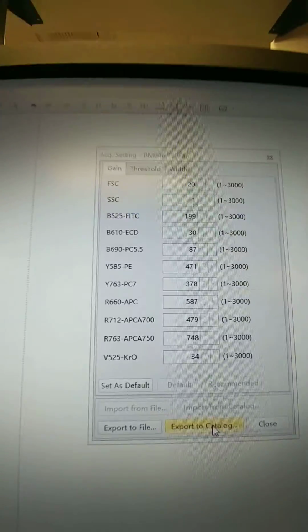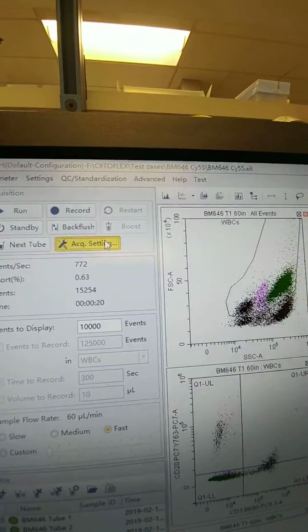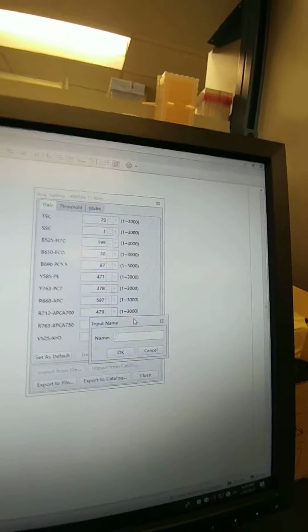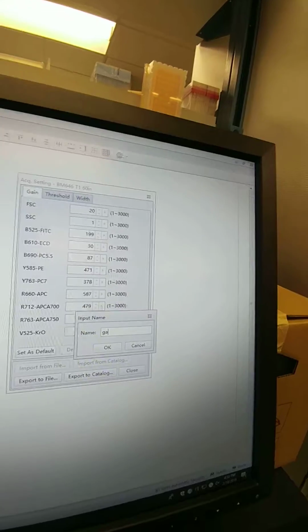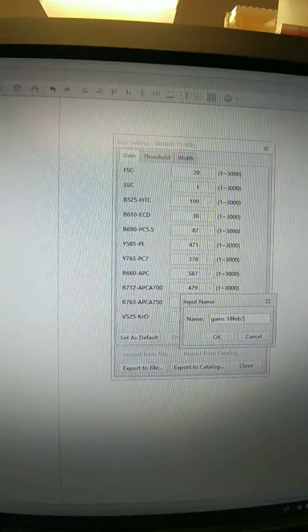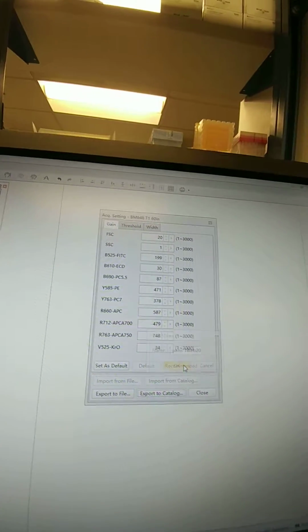All right, say these are the ones we're ultimately going to use. We're now going to click Export to Catalog. Again, that was from coming here, selecting the tube you want, clicking Acquisition Settings, and now doing Export to Catalog. Then you're going to name it, let's see, gains. You can put today's date, you can say updated date gains, name it whatever you want so you know that these are the new gains you want to use when you run your next sample. Click OK, and then close.